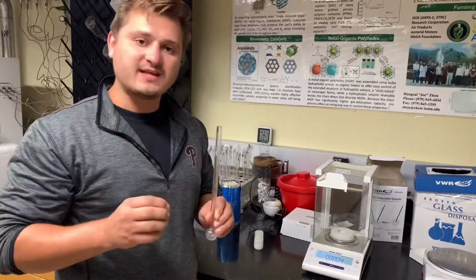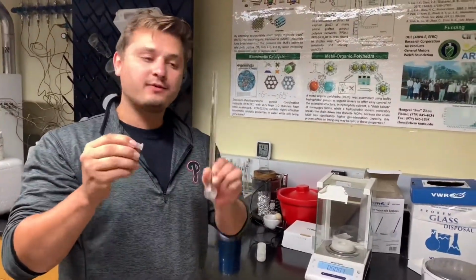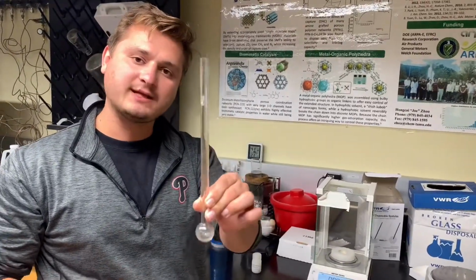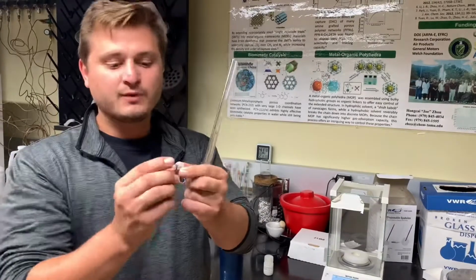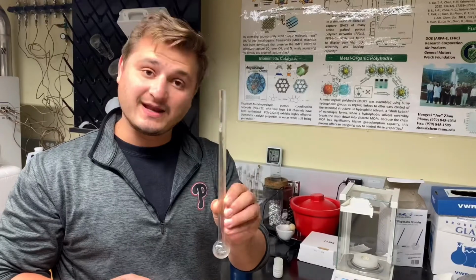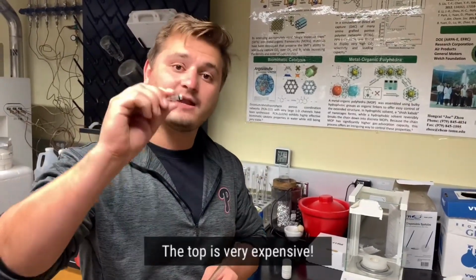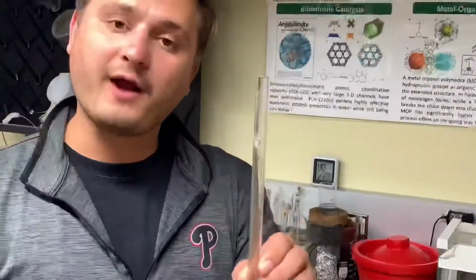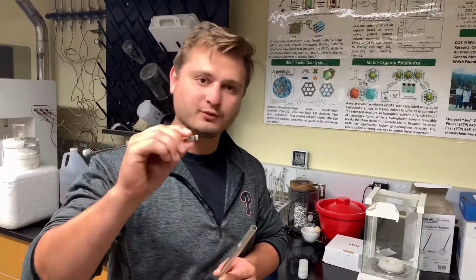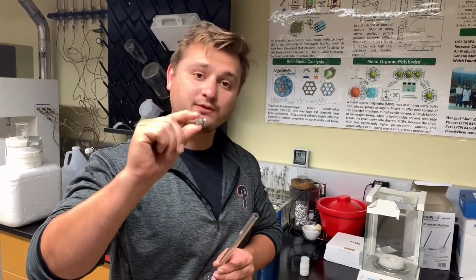So after we create the sample file, we want to come over to our balance with an empty, clean tube. There are two portions to the tube: the analysis tube, the BET or ASAP 2020 sample tube, and the top. The thing I want to get clear is the tubes are sort of inexpensive. They are replaceable. But the tops are very expensive and sort of irreplaceable. So if a tube breaks, do not throw away the top. Keep the top. It can be reused for other sample tubes. Like I said, the top is very expensive, and you do not ever want to throw away the sample top.